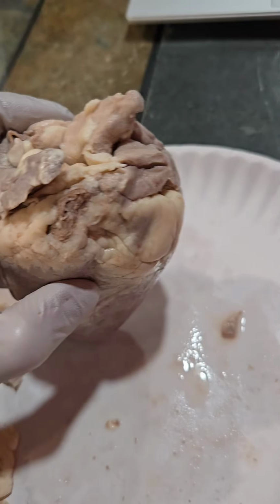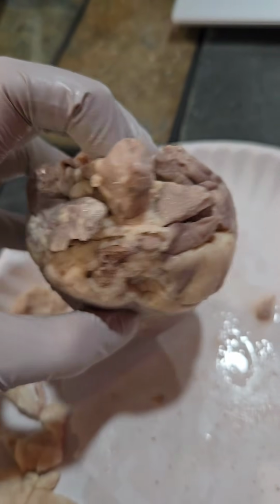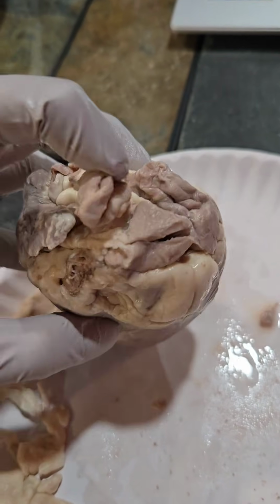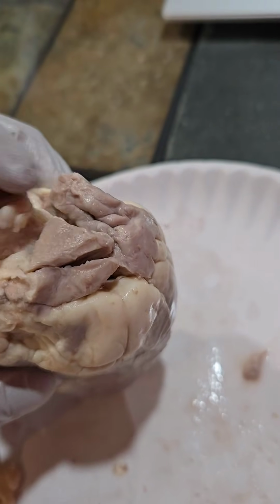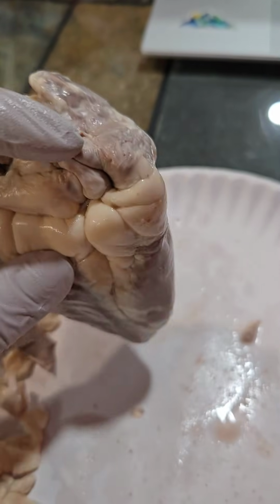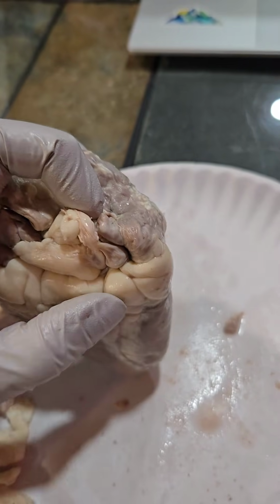At the top we have multiple different blood vessels. Here we have the aorta, which pumps blood from the left ventricle into the rest of the body. On the brachiocephalic trunk, it splits into the subclavian artery and the right common carotid artery. Superiorly, we have the superior vena cava. Below that would be the inferior vena cava.